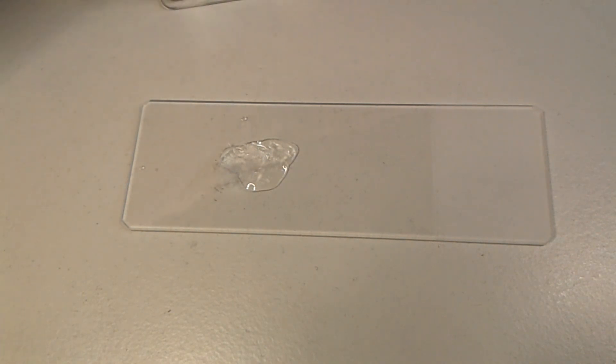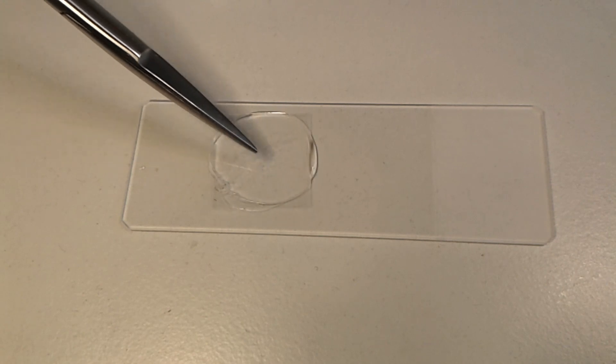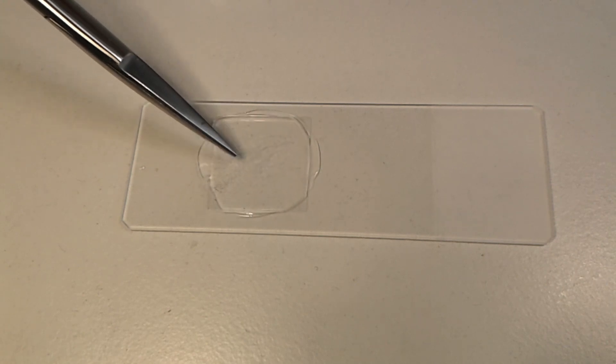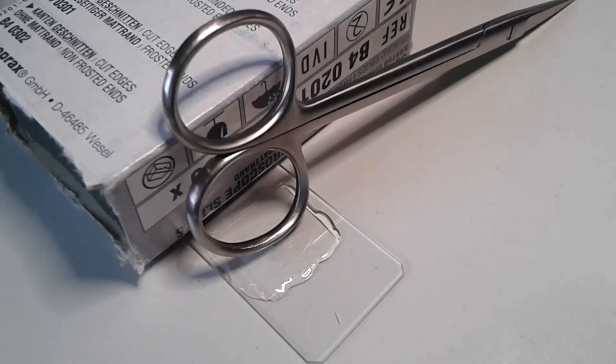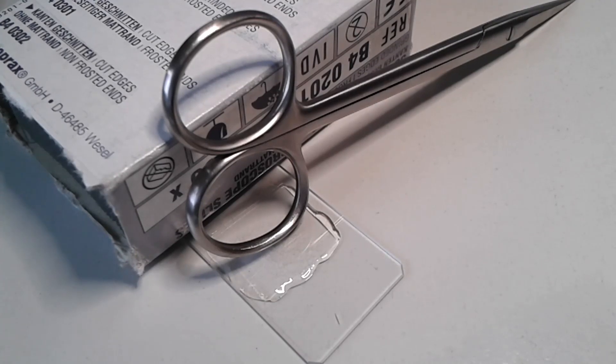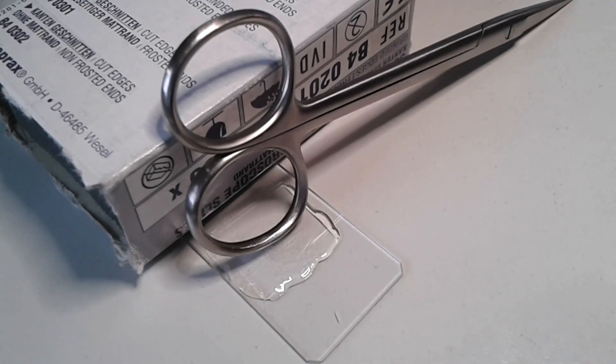Some cover glass, of course, and I do not know if this actually is not a little bit too thick. So, let's try it. Maybe it does work. I'm going to give it some time now to dry, and then let's put it under the scope. And this way I'm applying some pressure on the cover glass right now to make sure that the specimen is sufficiently thin.